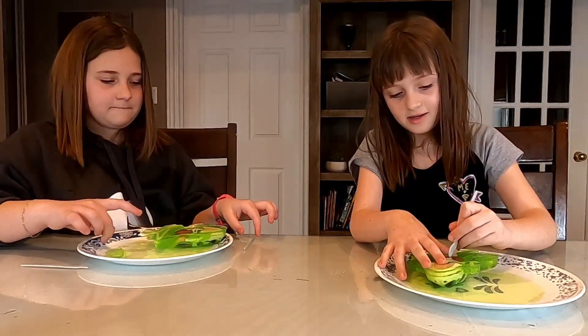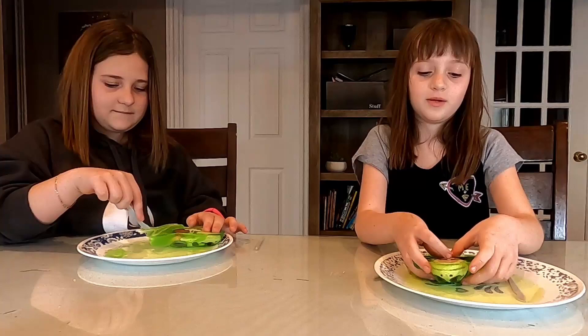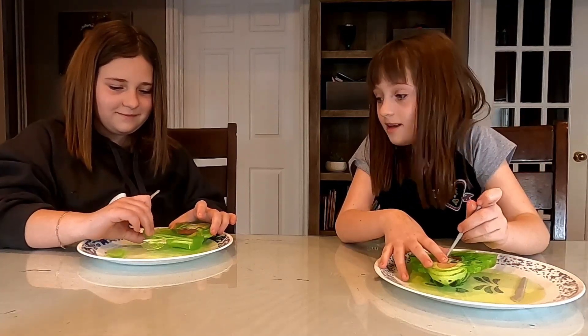Start with the middle. Don't forget this is a challenge and good luck. Let's get it open. I'm getting it down to his feet for some reason. Let's cut his feet off. Alyssa, you have already failed — you're supposed to cut down the belly.